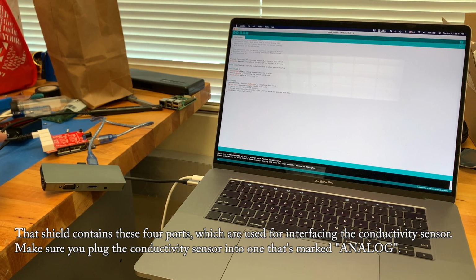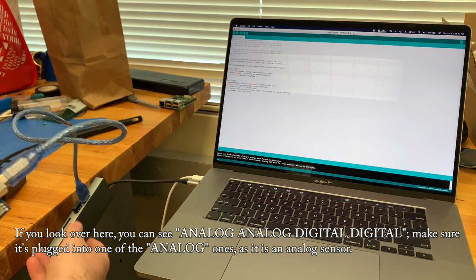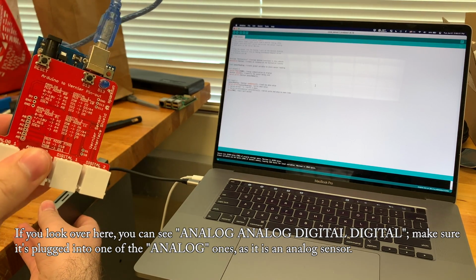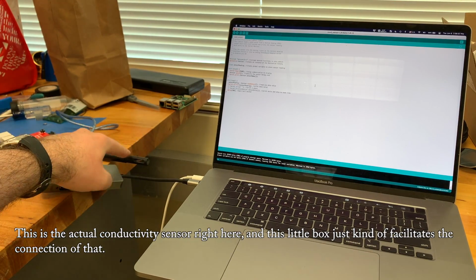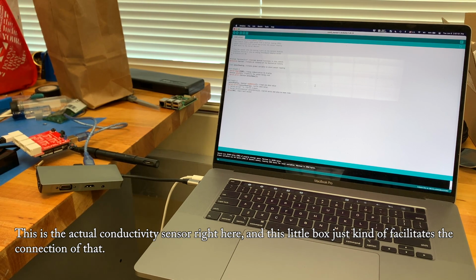Make sure you plug the conductivity sensor into one that's marked analog. If you look over here, you can see analog, analog, digital, digital. Make sure it's plugged into one of the analog ones as it is an analog sensor. This is the actual conductivity sensor right here, and this little box just facilitates the connection of that.